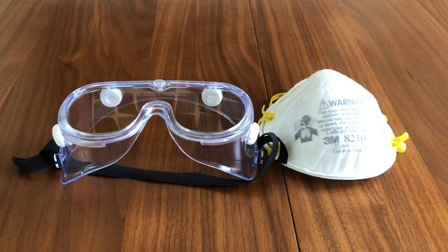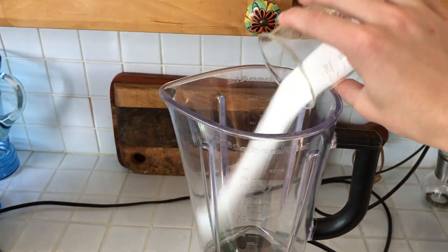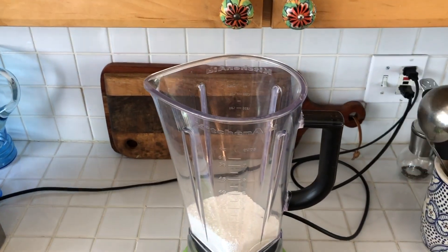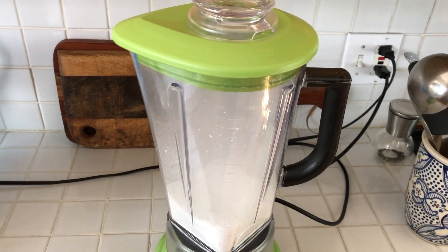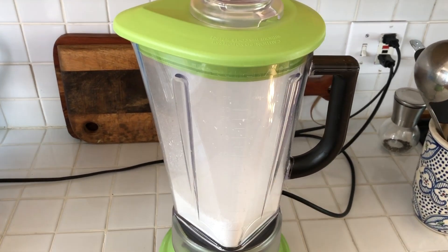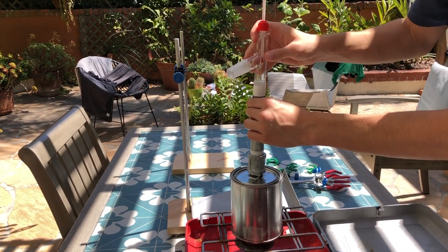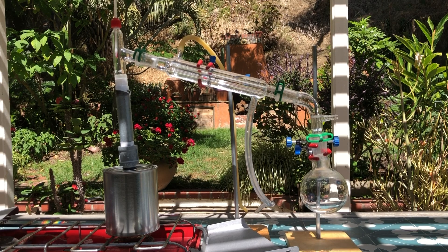This next part will create a lot of dangerous sodium hydroxide powder, so it's important to wear safety gear. The sodium hydroxide and sodium benzoate were finely powdered and mixed together in a blender, because the distillation will be dry. No solvents will be used, so we have to maximize the contact between the two reactants. The powder was put into the reaction vessel and my still head was fitted into the pipe with a lot of PTFE tape.